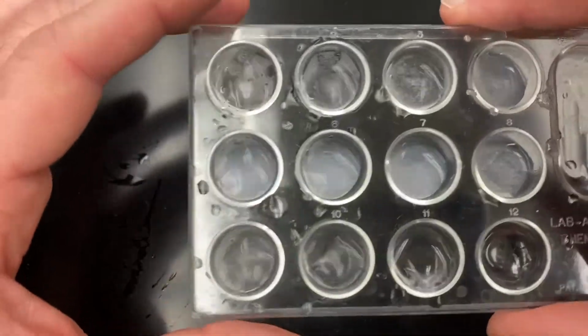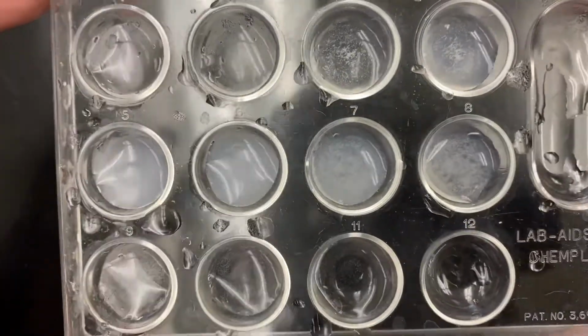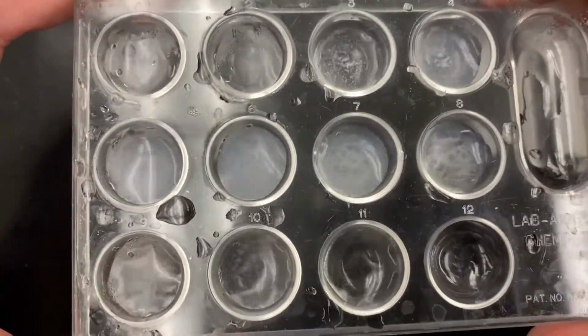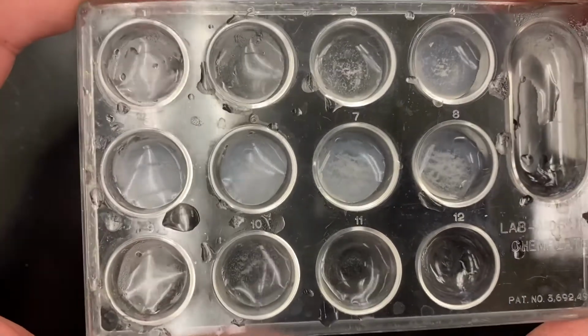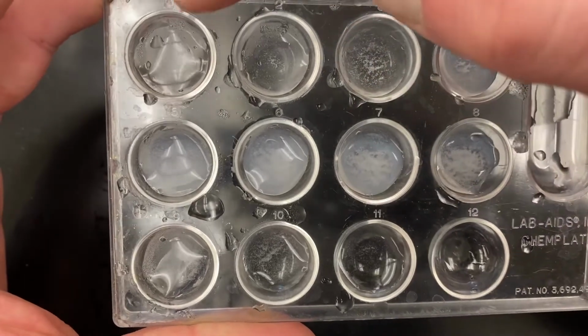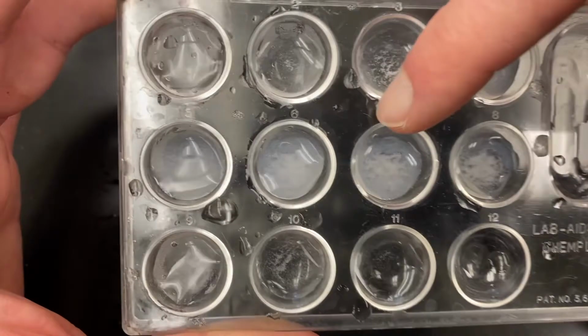Looking at the reaction between lead 2 nitrate and sodium oxalate, I could see that the most precipitate looks to be, we're still letting them settle, but probably going to be cell 6 or cell 7. And so this is 1 drop of lead 2 nitrate, 2, 3, 4, 5, 6, 7.